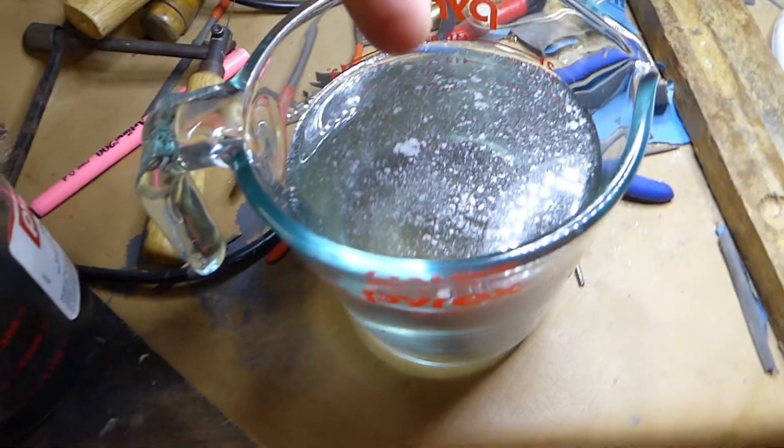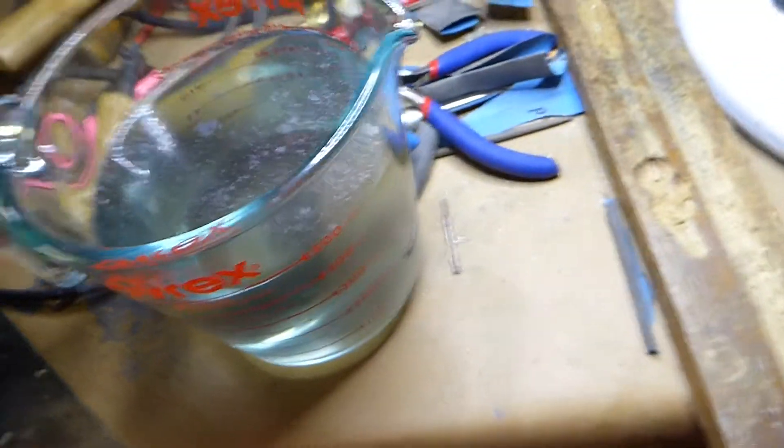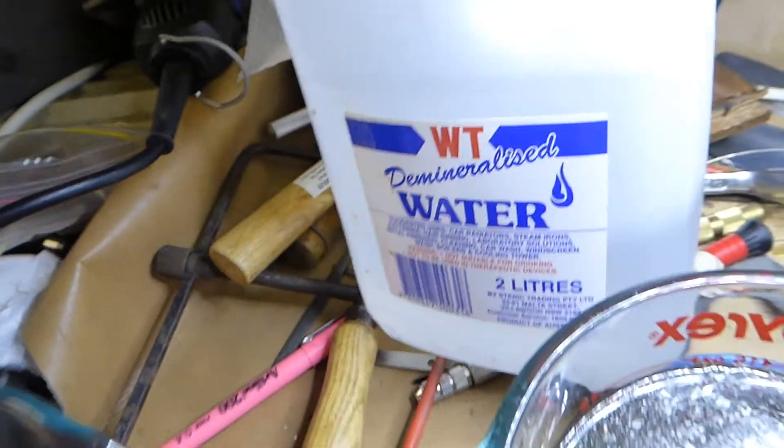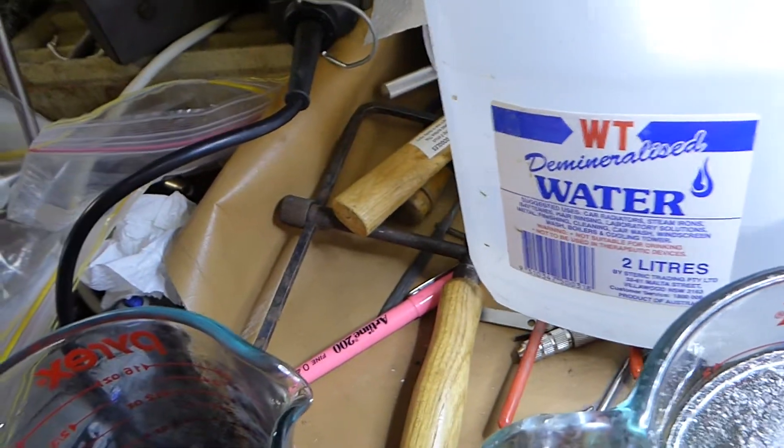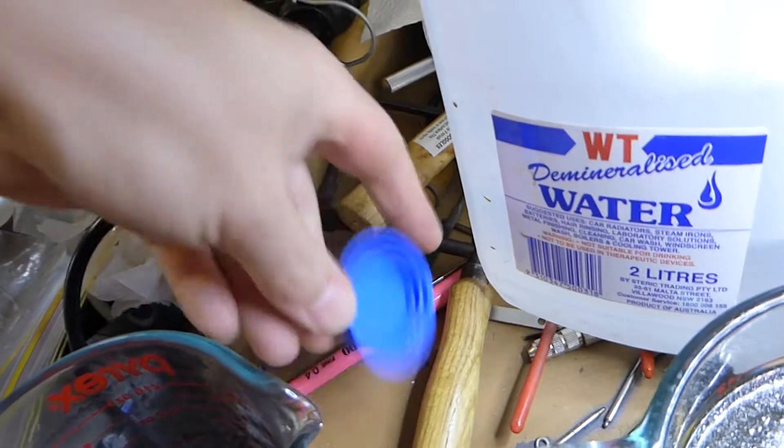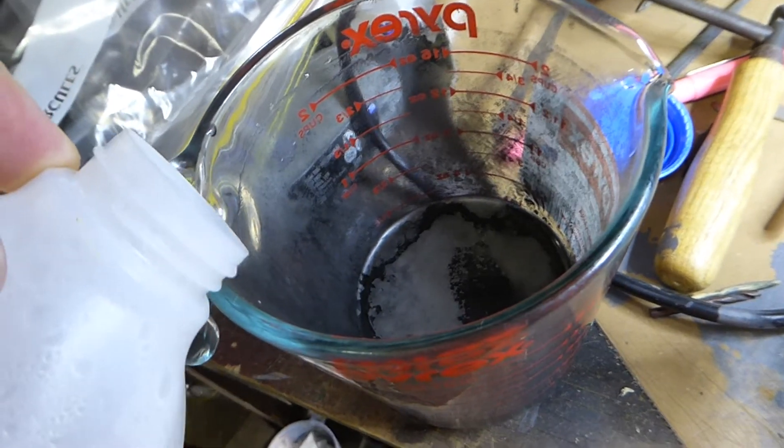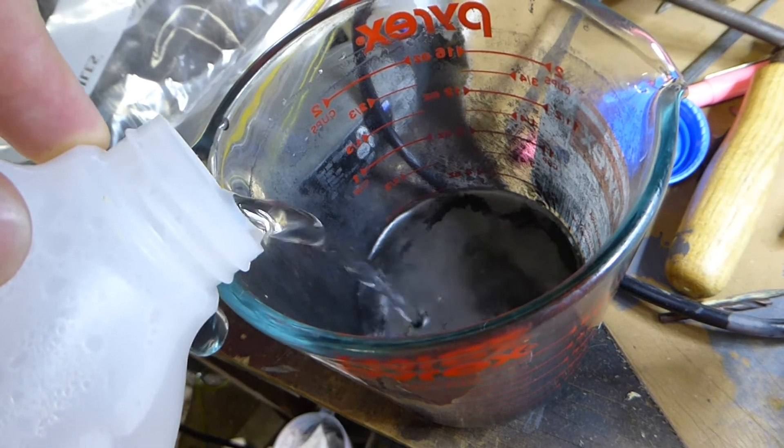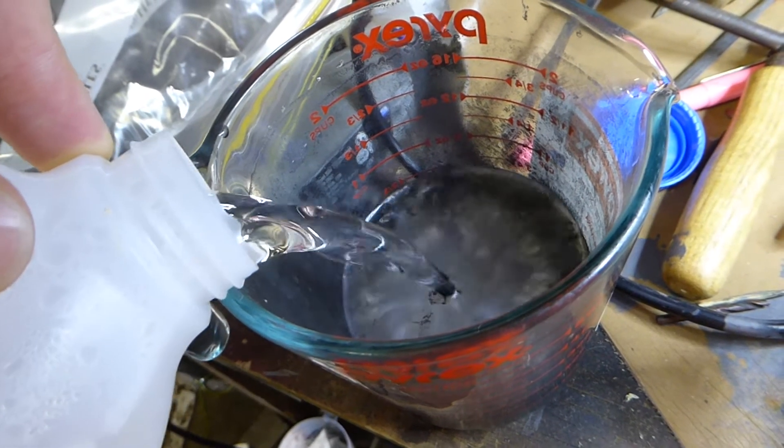I'll try to neutralize this as well because there should be some quantum dots in there. There's some cheap demineralized water from Coles or Bunnings or wherever I got it. I don't recall. Need to wash it properly. It should be three washes I'd say.